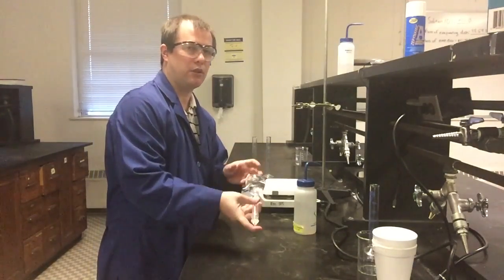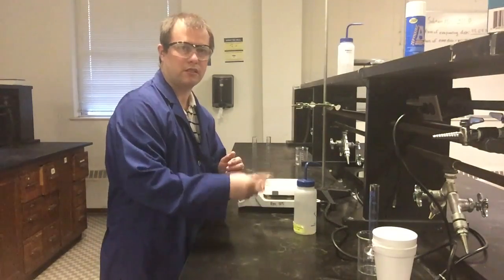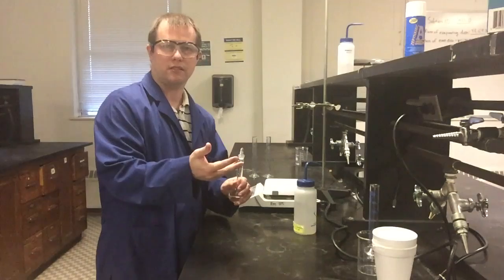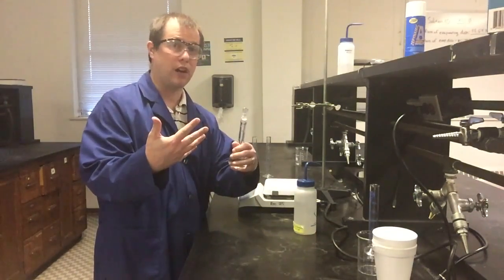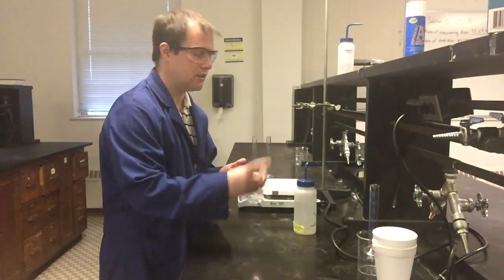With just water and HCl, we don't expect there to be a lot of built up pressure, but it's not something you want to risk by just constantly shaking and not venting, because if you don't vent and there is some pressure buildup and it's HCl that's in here, you're going to spill acid all over your hands. So if you're not wearing gloves, like I'm not at the moment, that could be a problem. You don't want to spill it on your hands.